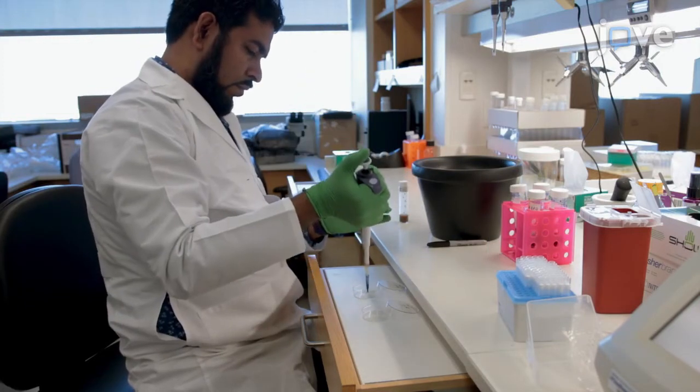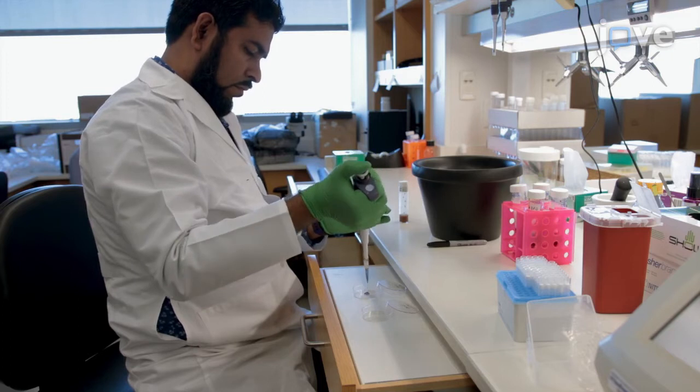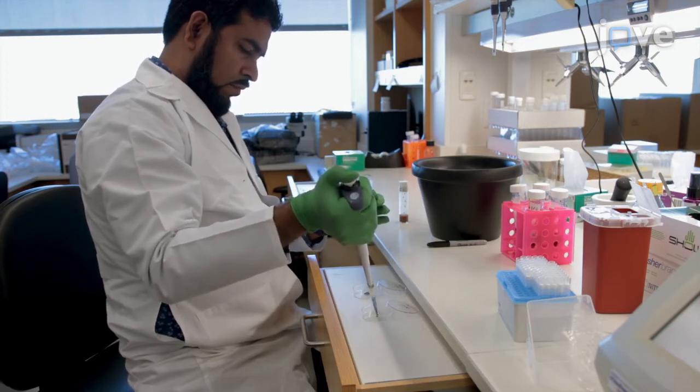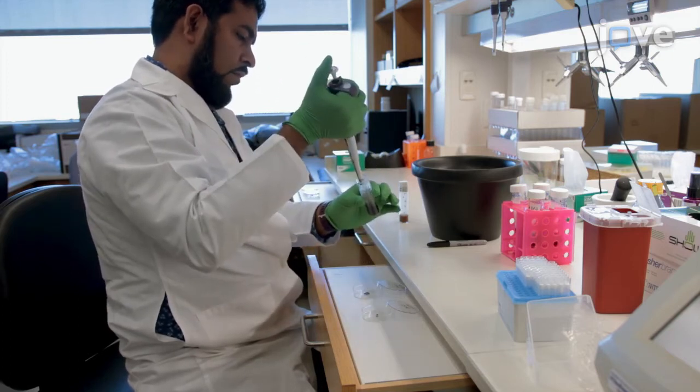Using a pipette, add the fly food containing BPB into a single dot of approximately 200 microliters in the center of a petri dish.